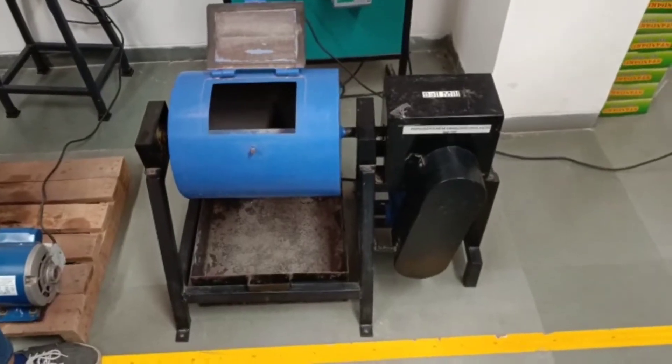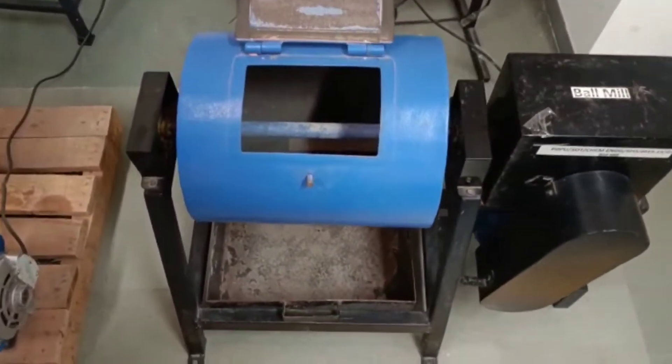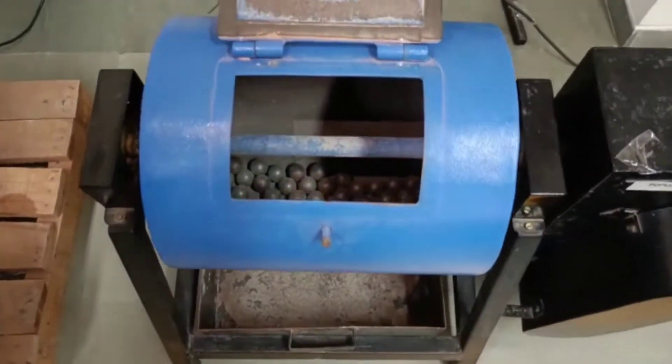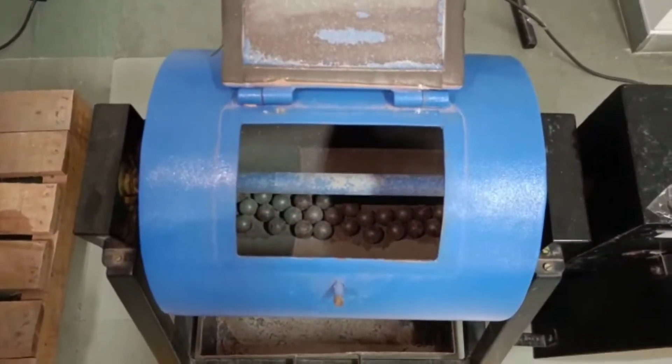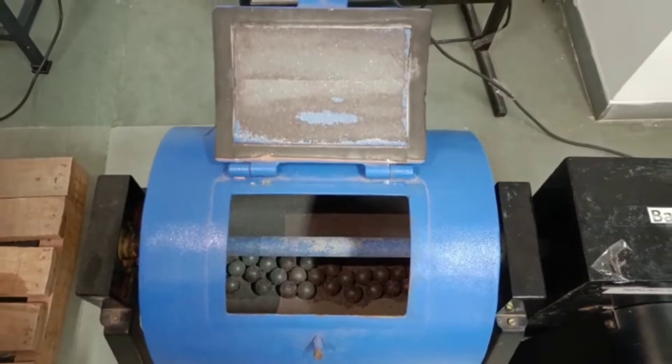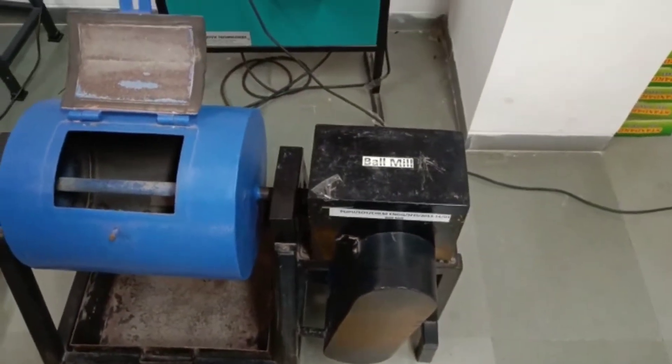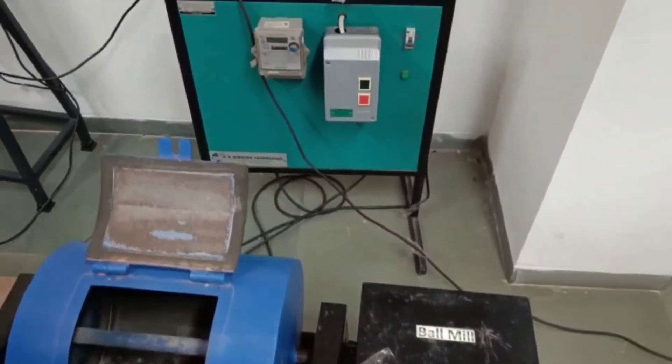This is the experimental setup of a ball mill where a fixed number of steel balls are encased within a steel cylinder and rotated to crush the feed.